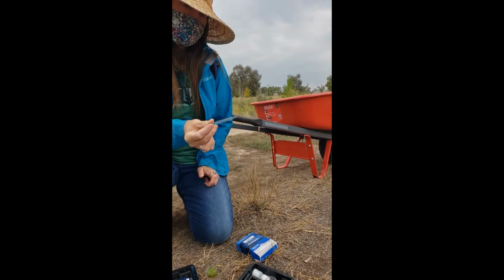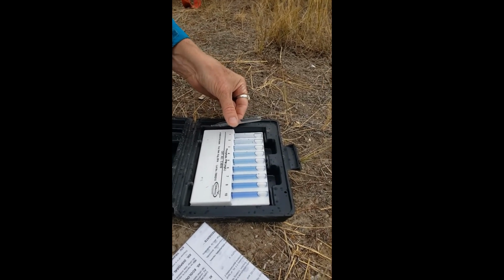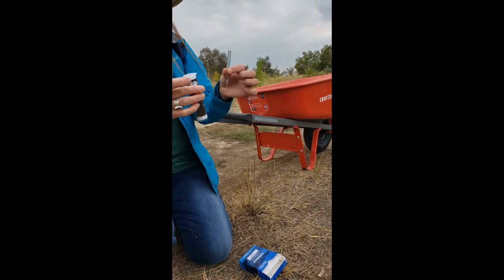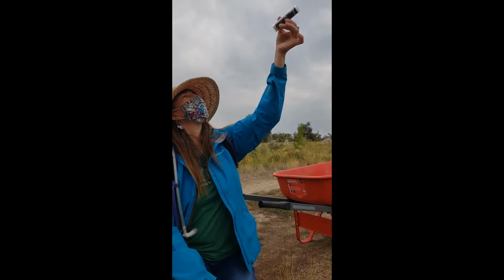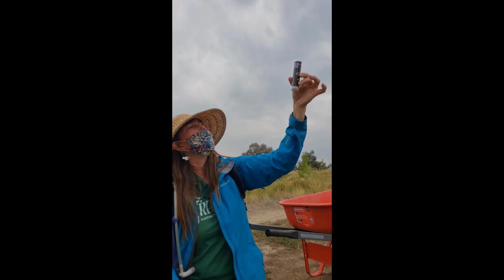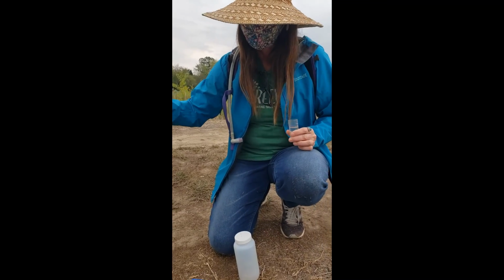Okay, looks like it's turning a little bluish. Okay, and then go to your comparator. Will this one take minutes, or will it go right away? Nope, this one is immediate. Oh wow, so it's really low in phosphate actually. Yeah, so then there's this really nifty low range ability. So you can stick it in with the bottom in, exactly. And then look at the bottom here and you can see which one it compares to. Oh, okay, so the highest one. In between the two top, the most blue. Okay, so that would be between 0.8 and 0.9. Okay, 0.9, perfect. And what are you testing for? This one I think is the nitrate.